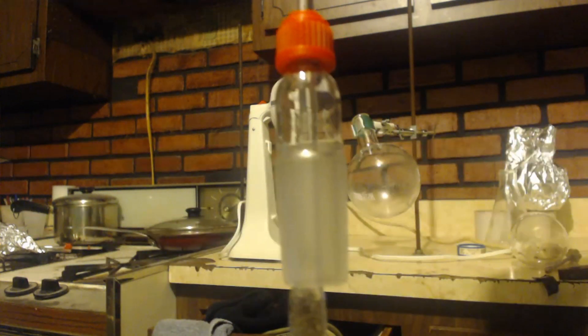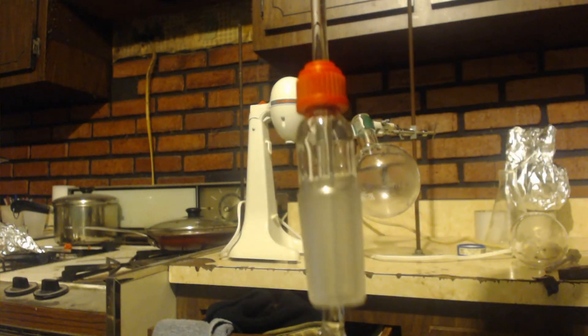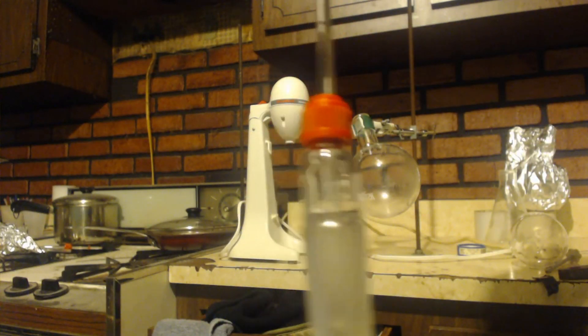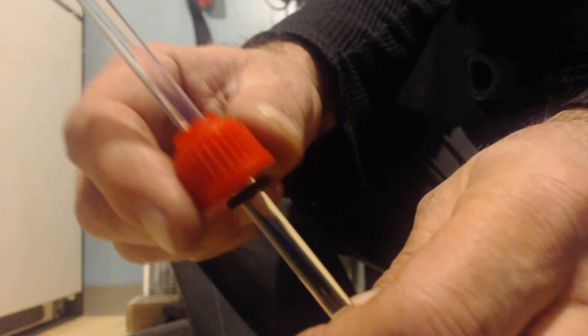Sometimes see how it slips down? Sometimes that's how it is, it's good enough to slip down if I jiggle it. Now this is that stir rod with the top, remember the plastic part.